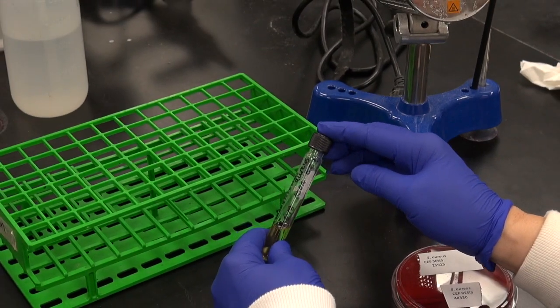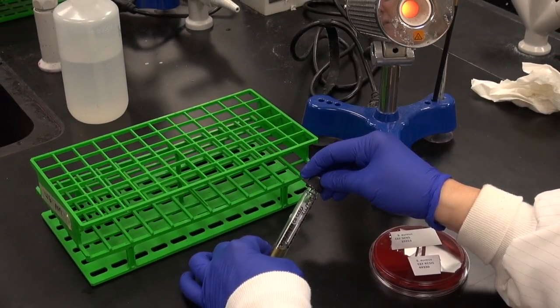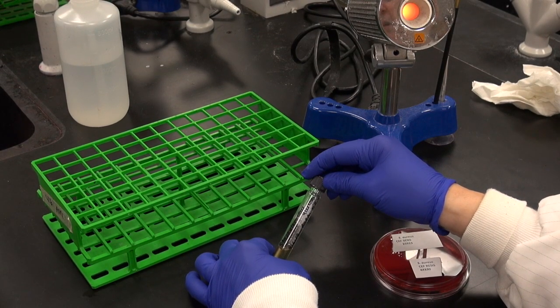Be careful not to lay the tube down flat while labeling as the lids may not be tight and you could risk the broth leaking out.